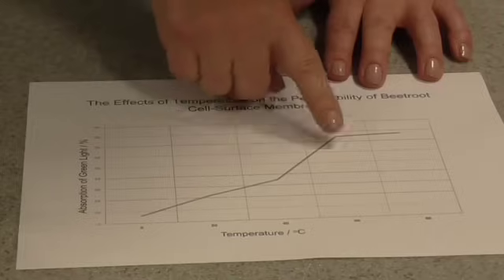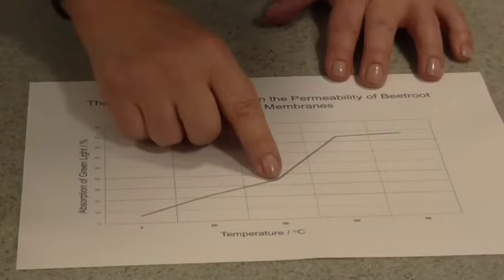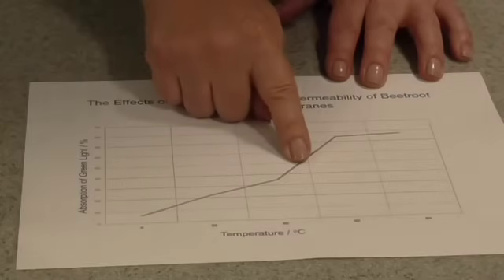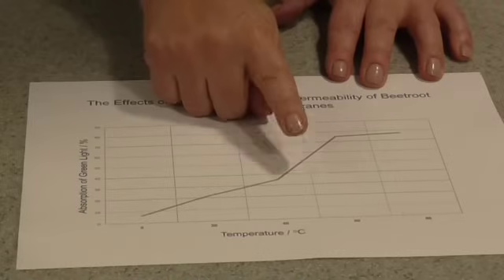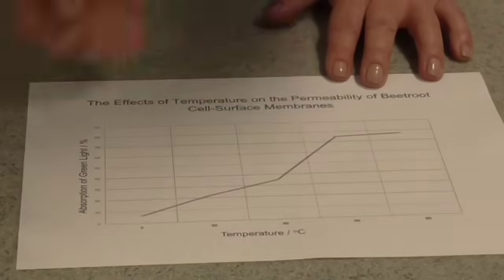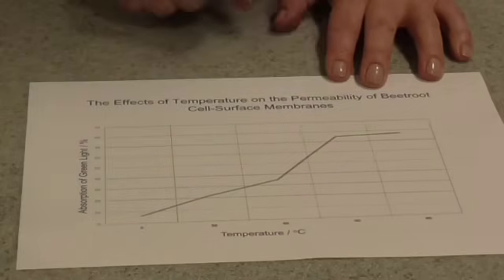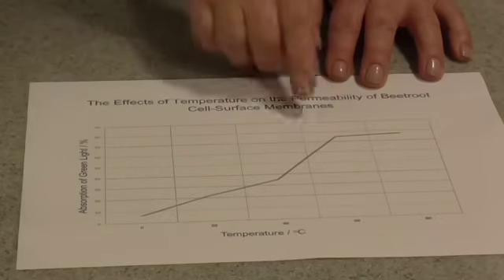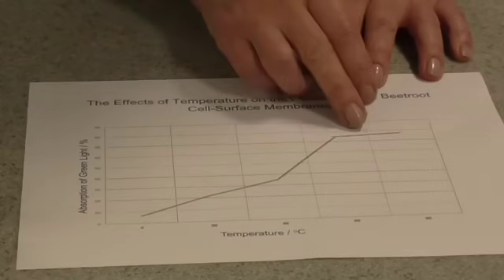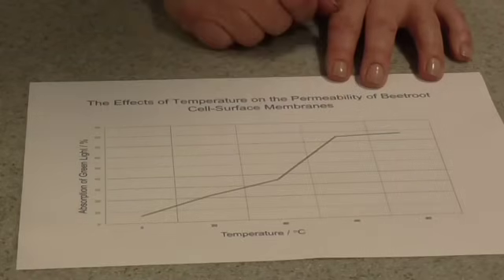Something a little bit different seems to happen above 40 degrees, because we see a more rapid increase in the leakage of anthocyanin from the cells. Probably what is happening is that the proteins in the membrane are now starting to become denatured, and the membrane is actually starting to fall apart, so all of the anthocyanin is leaking out. Up at the higher range of temperatures, it seems to plateau — probably because we've reached a point where the membrane has totally disintegrated, the anthocyanin has leaked out until it's reached equilibrium with the solution, and there's no more left to leak out.